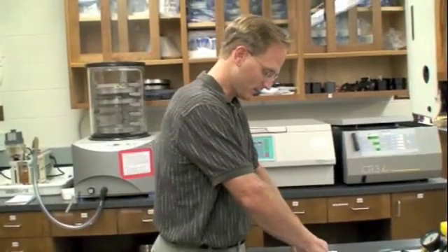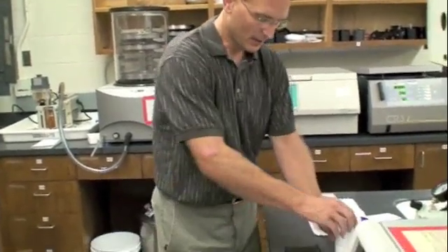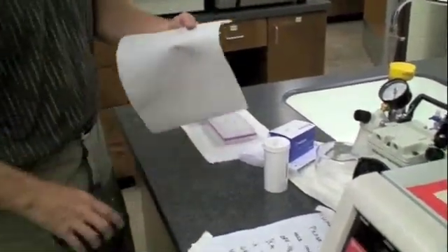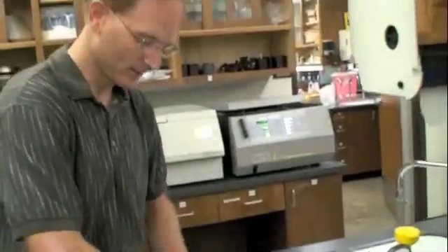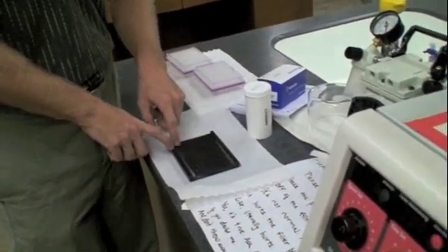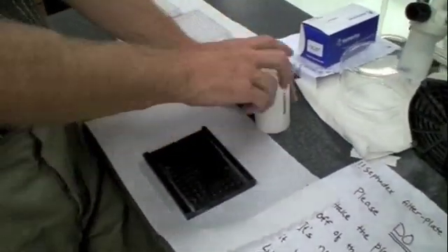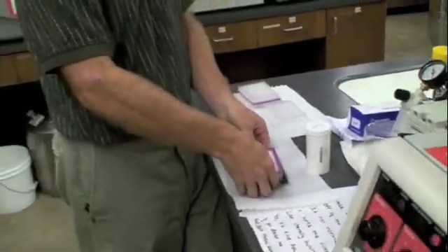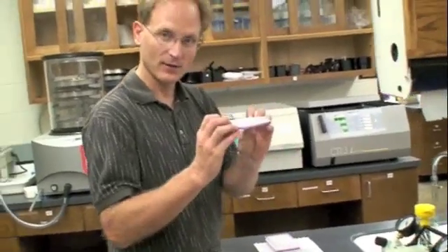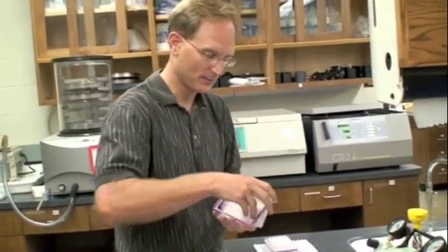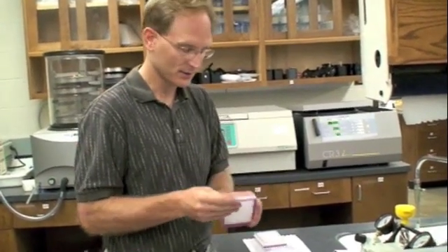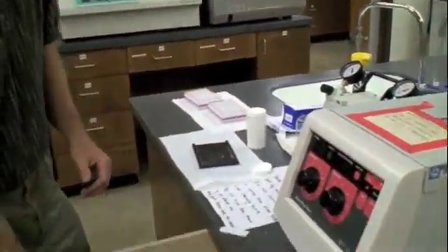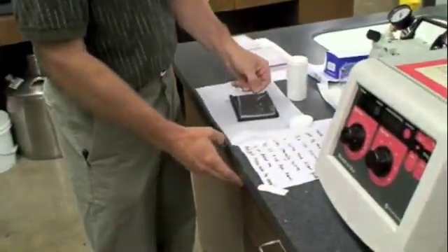To do the Sephadex, we've got the plate set up here. We need to get the right amount of Sephadex into each one of these wells. When we do that, I often will put a paper towel down first. Each one of these holes is the same size. It's been drilled or machined to the same size. We fill up each one of these holes with Sephadex. Then essentially we put the plate on upside down, turn the whole contraption over. The Sephadex powder dumps into the wells. Then we have all the Sephadex, the same amount of Sephadex in each well. Then we simply add water to all the wells. You have to be careful. It's easy to put too much Sephadex on here.